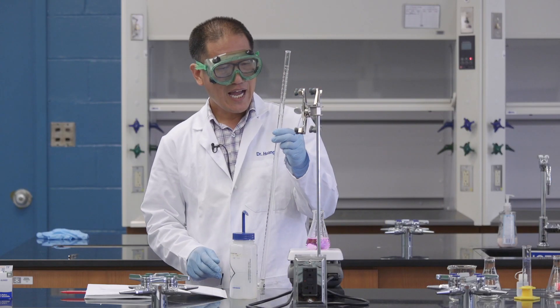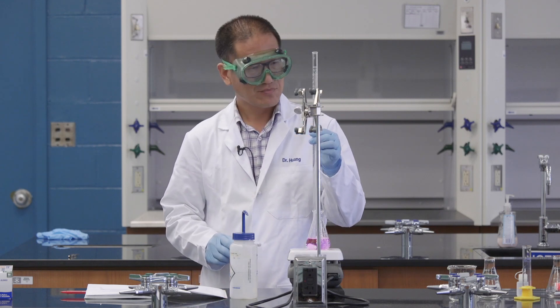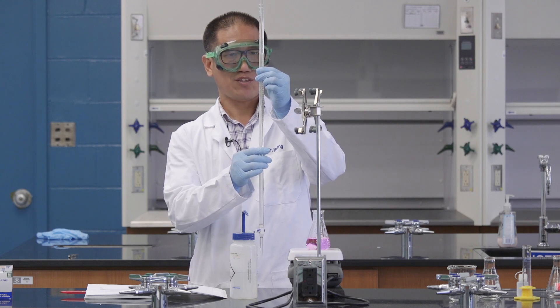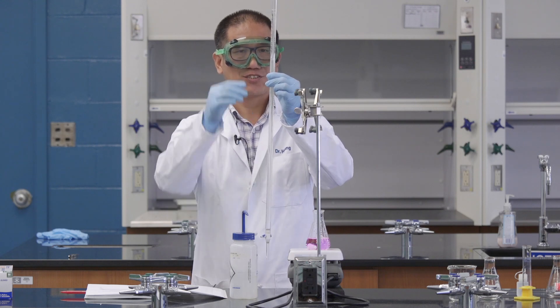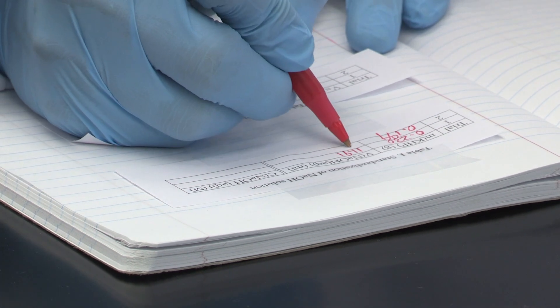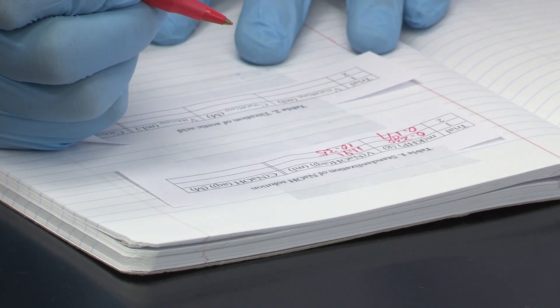Let's see how many milliliters we use for the second time. This is 10.35 milliliters. We need to record the number immediately. It's 10.35 milliliters.